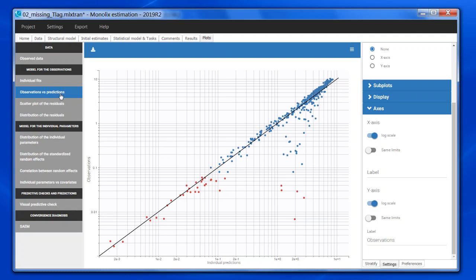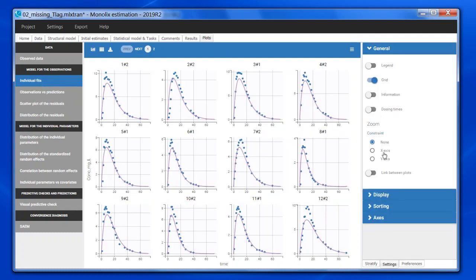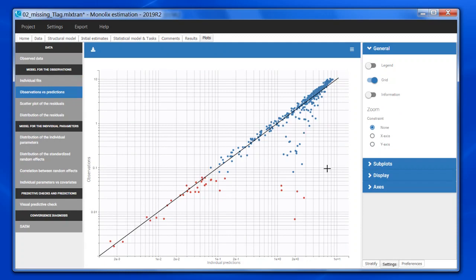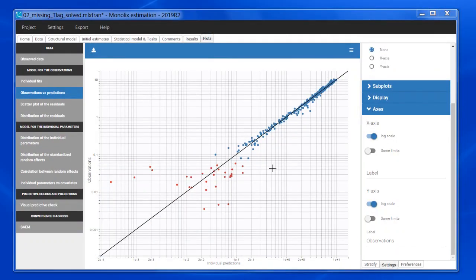We can also see it in the individual fits. If I zoom on the early absorption phase, I see the missing T-lag. It is good to remember this pattern, because with multiple doses and somewhat sparse data, we often forget to look closely at the absorption phase in the individual fits. So if you see this pattern, it is a good hint of a missing T-lag. If I now add the T-lag, then I get an observation vs. prediction plot like this, where the smear has disappeared.